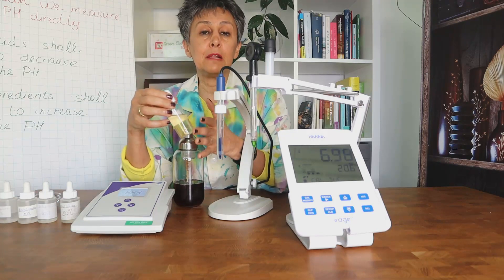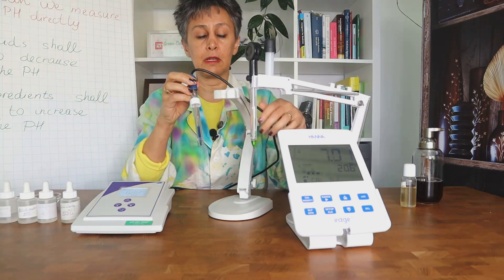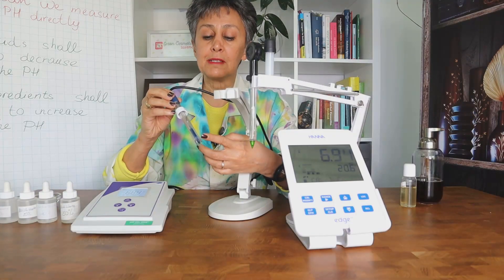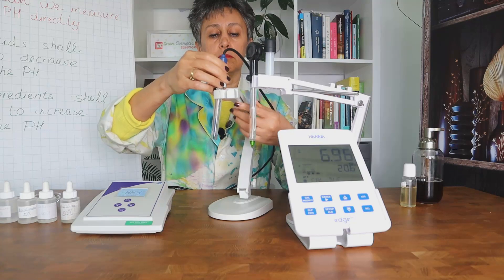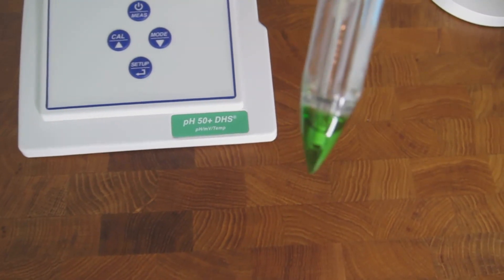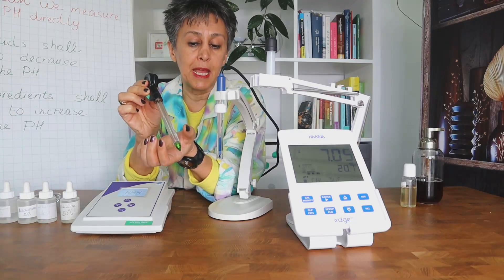This is when dilution still makes sense, although technically you can measure directly. Another factor is the type and shape of your electrode. Here I have two pH glass electrodes. This one is a conventional electrode — the shape is like we know from high school — and with this one you cannot measure the pH of a cream directly. The other electrode is a specialty electrode with a pointed tip, much more expensive, and typically used in the food industry for measuring the pH of cheese and bread.